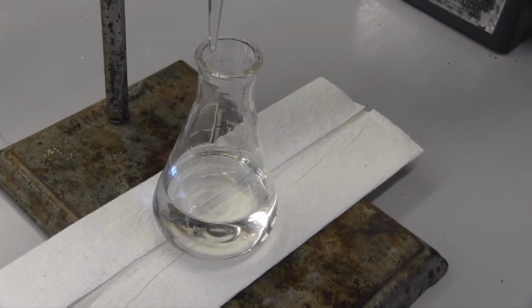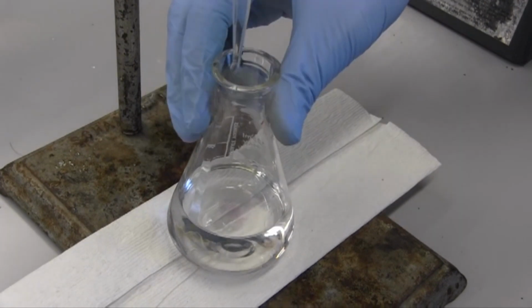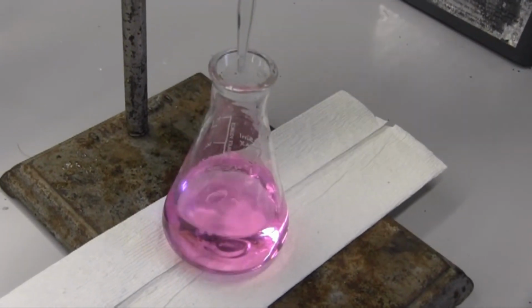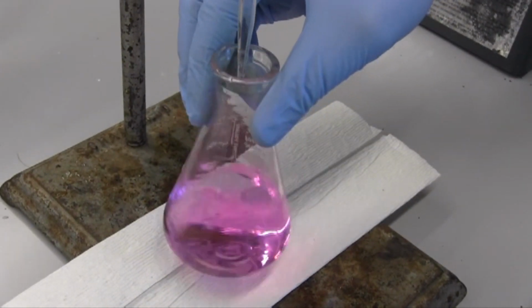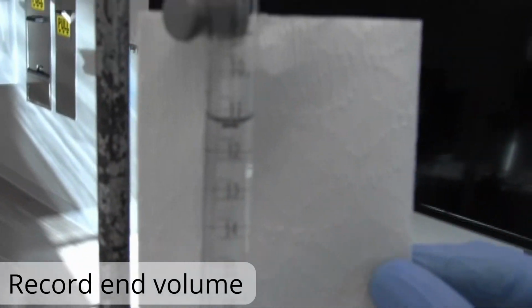Every time we swirl, we make sure that we're getting an even distribution of acid and base throughout. And there we go. We've reached the endpoint here. You see that nice pinkish purple hue. And we can record our final volume for our sodium hydroxide.